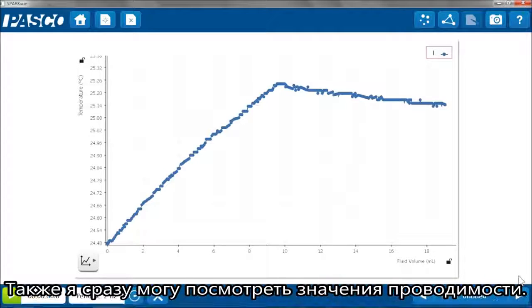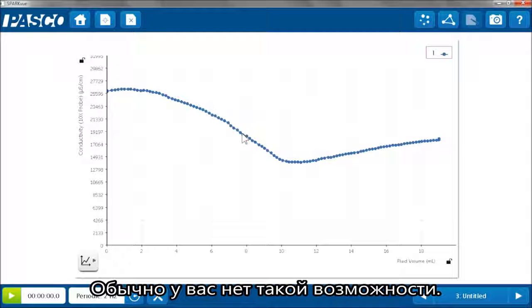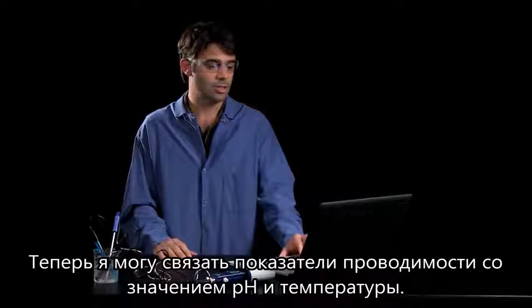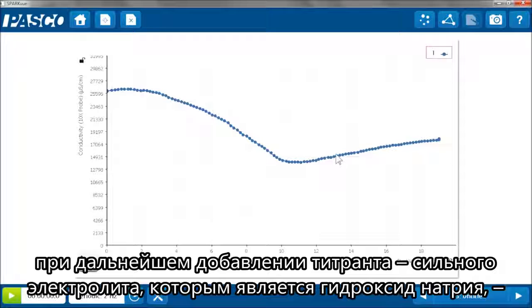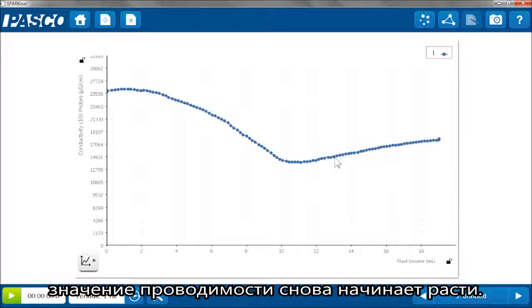And I can also look at the conductivity. This is the thing that you can't normally do. This is the nice thing about the Advanced Chemistry Sensor. Now I can tie in conductivity with pH and temperature. My conductivity started high, got lower as I was producing more and more water until the equivalence point was reached, and then I went beyond the equivalence point and I was just adding more of a strong electrolyte titrant, sodium hydroxide. My conductivity started to rise again.